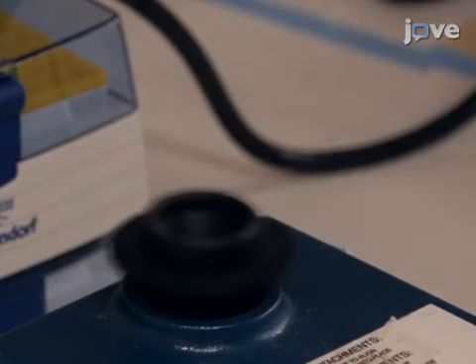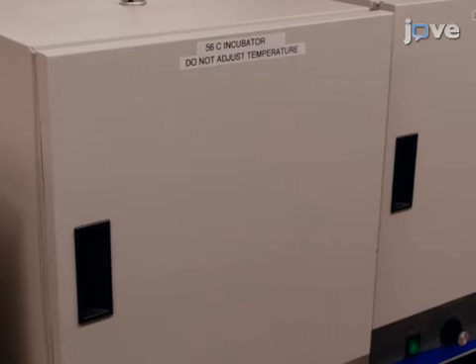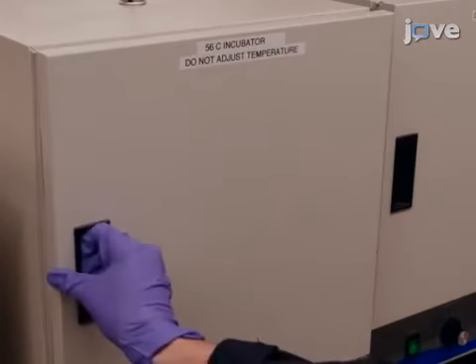Cap the filter sample tube and lightly vortex, being careful not to disturb the filter from its seat. Incubate the sample at 56 degrees Celsius for 30 minutes to denature the proteins and glycoproteins.